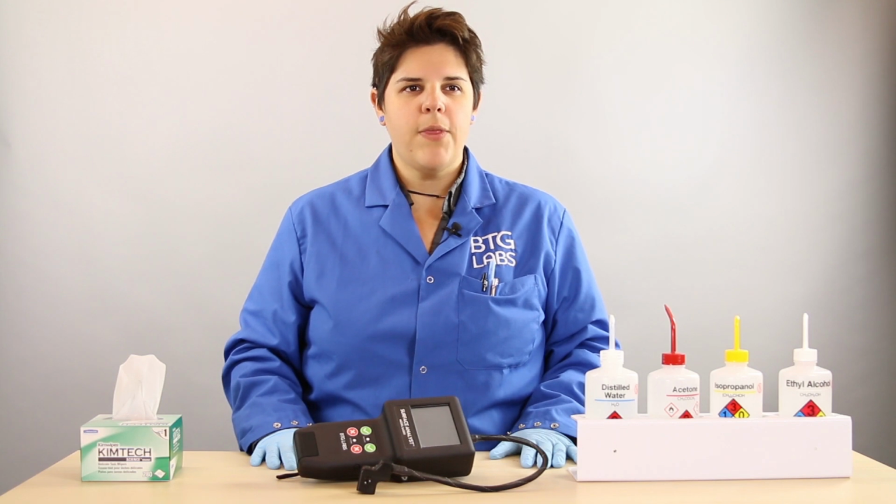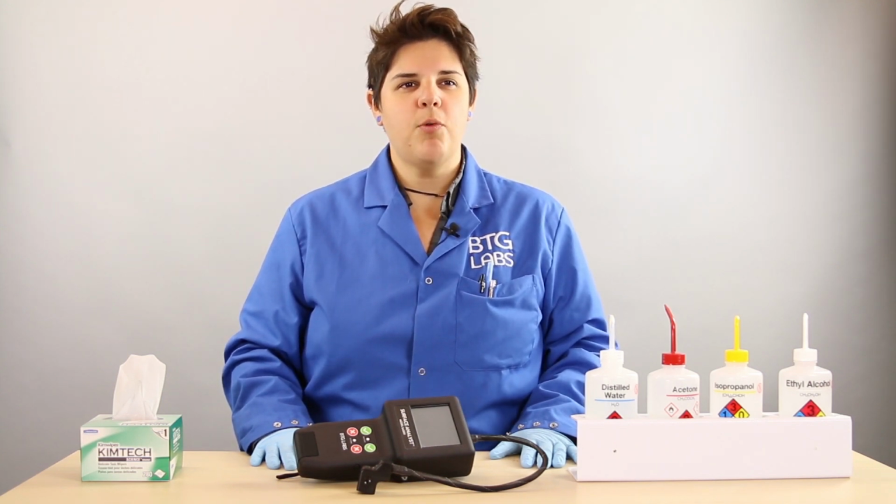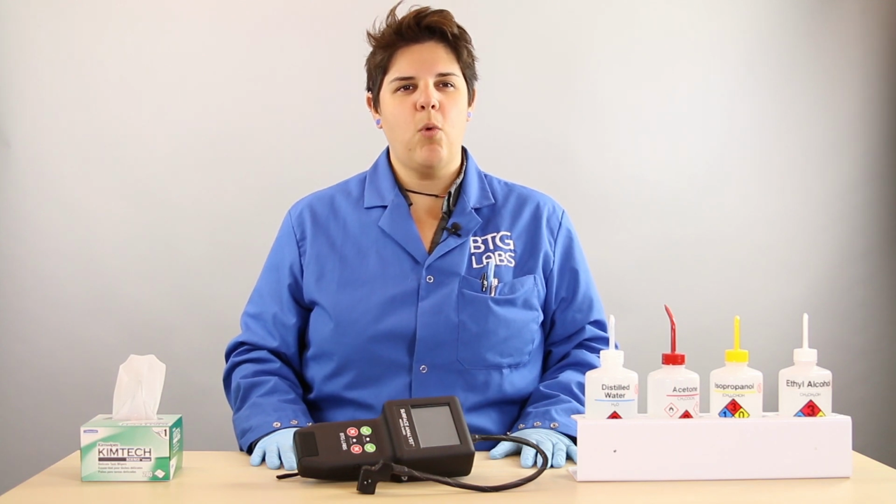Whether using the Surface Analyst with your samples in the lab or in the hands of an operator on the factory floor, you've just gained real-time and valuable business insights while dramatically improving quality control. Fast, easy, accurate, and non-destructive. That's the power of the Surface Analyst.